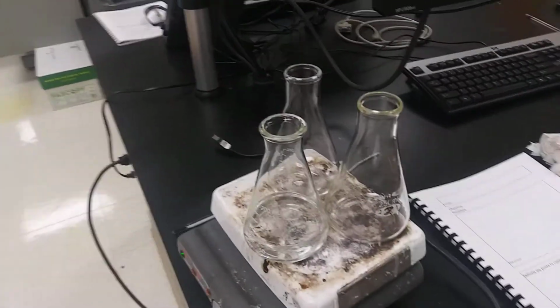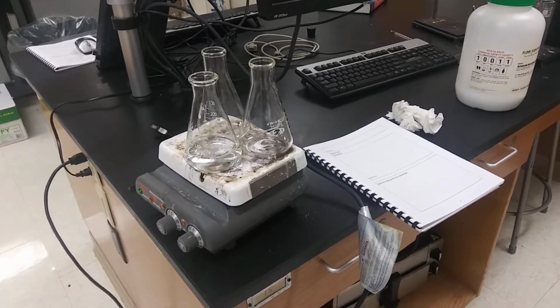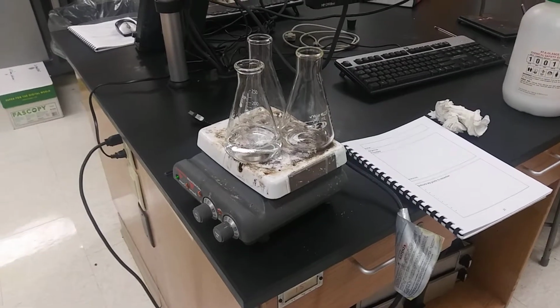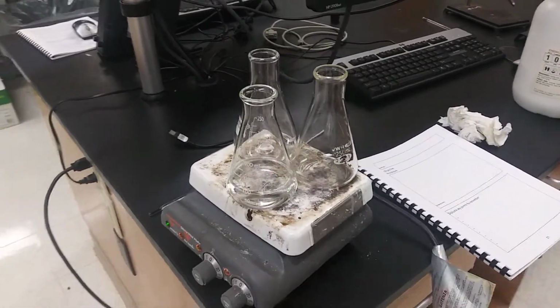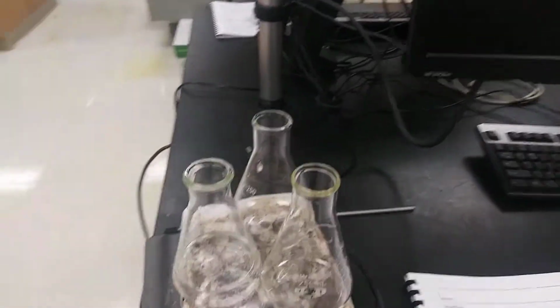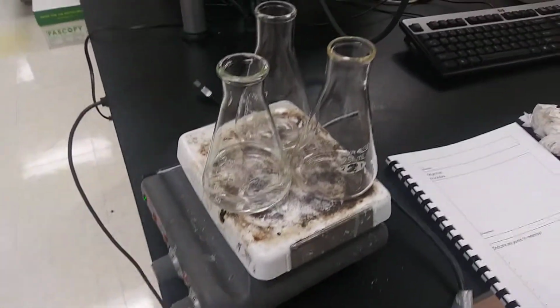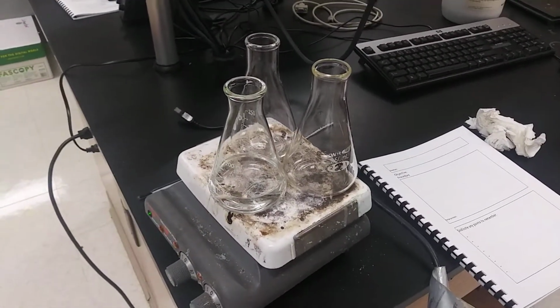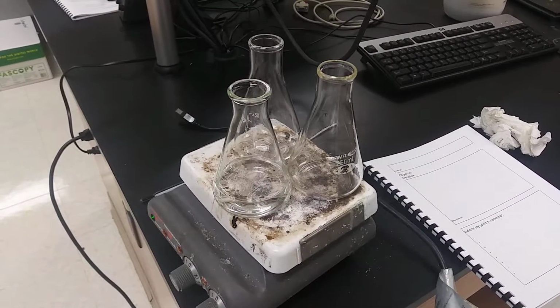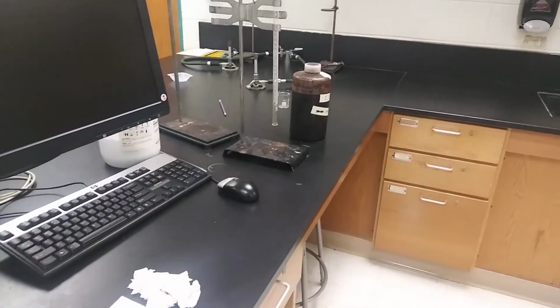Alright, so now we have a little bit of a tidbit of video, showing you a few things you might want to know hazard-wise, and just generally organizing-wise, about going from the heating process. Now this takes place in the first half of the lab, where we are going to be looking to gather the concentration of our unknown, which is a permanganate solution. My permanganate solution is located right there, and I want to test it.